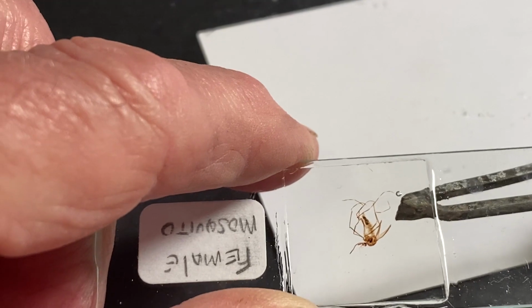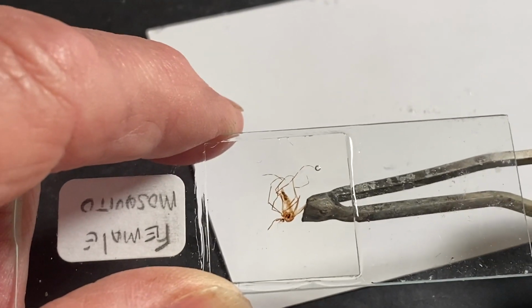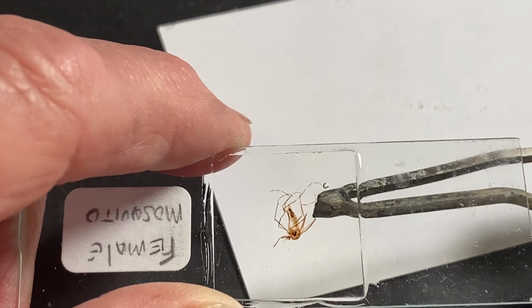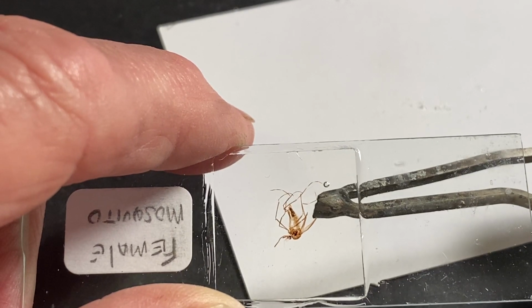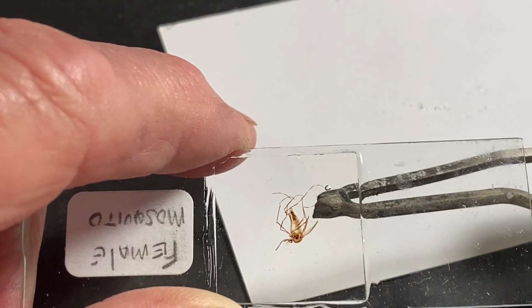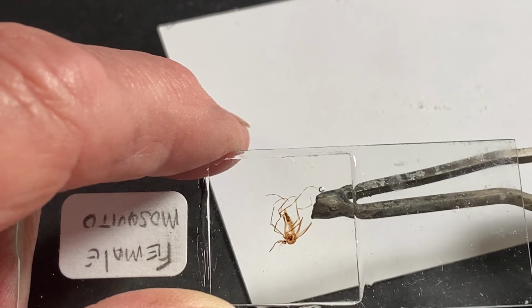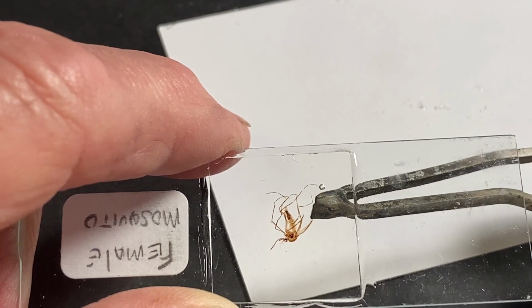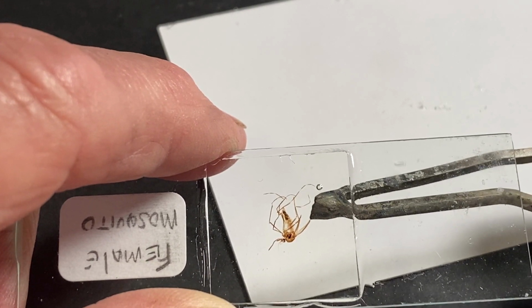slide in the area here. There we go. Let's do that. And when the resin starts to melt inside, sometimes it automatically moves, or we have to coax it. You know what? It's not going to do anything because I turned the heat off. How silly of me. But I'm not going to stop the video and start over again. You get the point. I like a soldering iron because it's a very hot tip.